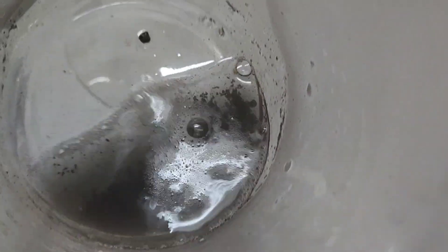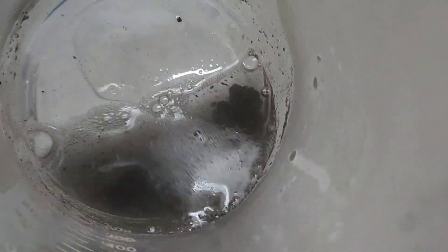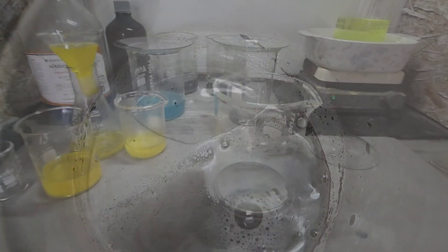So we'll let it keep rocking and we'll melt this up so we can see exactly how much silver we removed out of those first two aqua regia blasts.